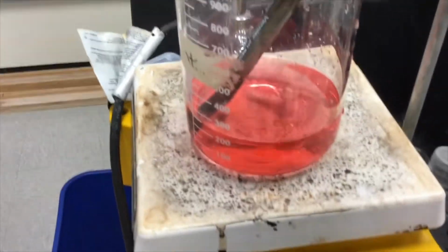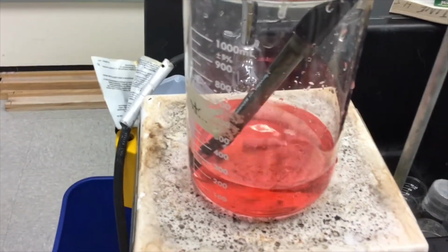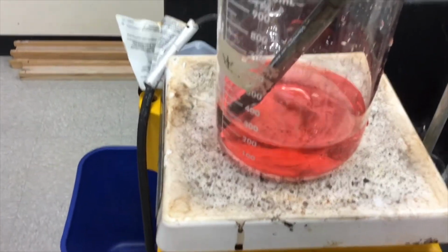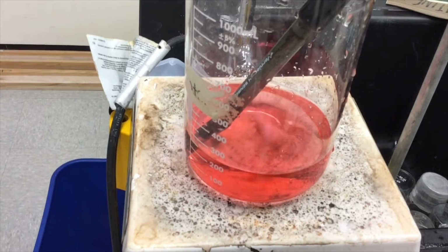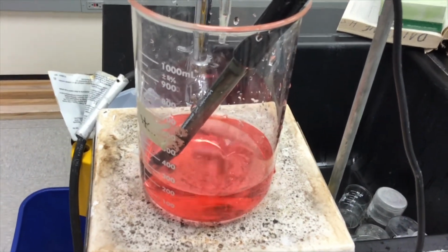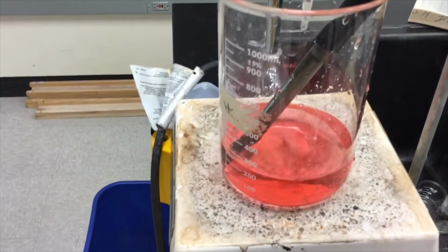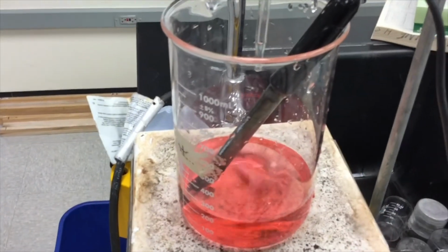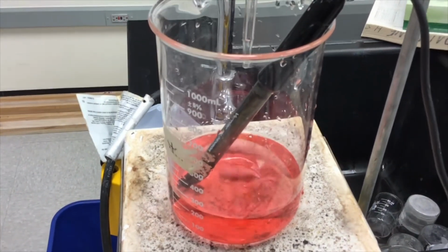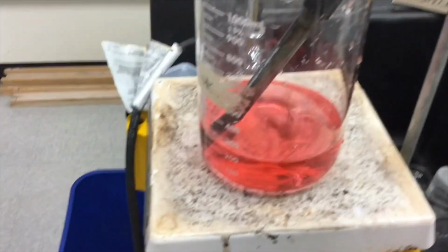I'm going to develop a titration curve where I have the individual data points set and ready to go, knowing what the pH is at the particular volumes. Once I have all of my data, and I have taken this through an entire spectrum of the titration curve from the acid side over to the basic side, then I should be able to figure out the concentration of my unknown solution that I just added in here.